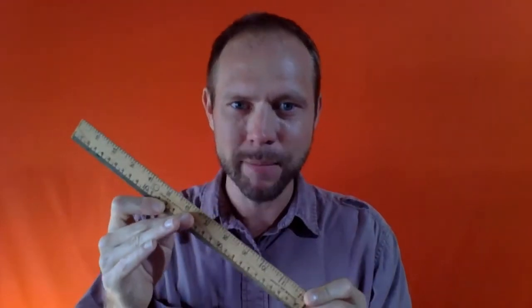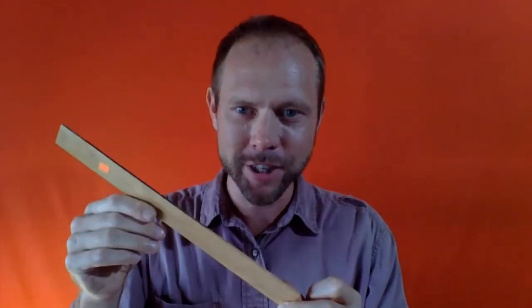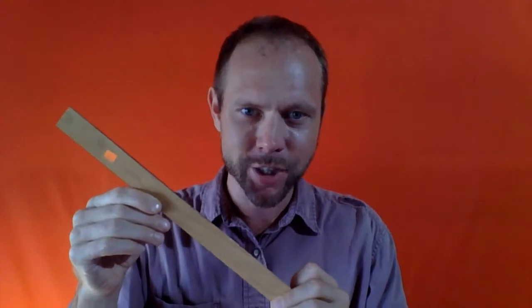So we're going to draw out the data table. I'm going to show you how to do it in just a few moments here. It's going to have 2 columns and 3 rows, 6 squares. Your data table doesn't need to have the exact same measurements as mine. It's fine if you just use a book edge as a straight edge to draw a nice data table and make it nice and big. It should be about a whole page big.